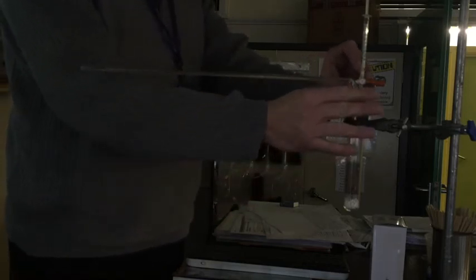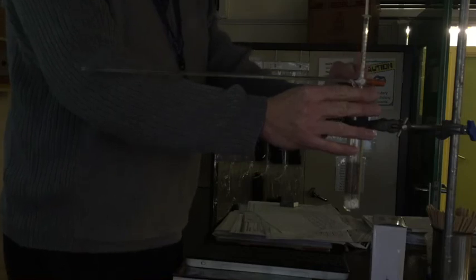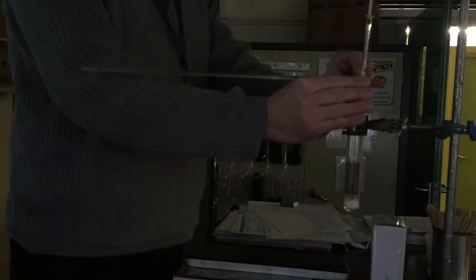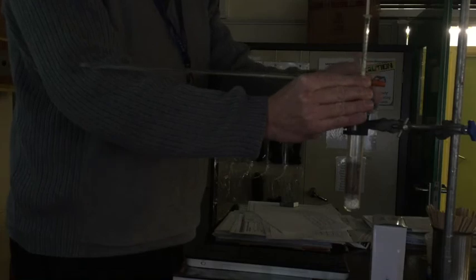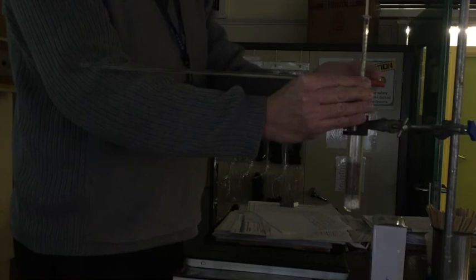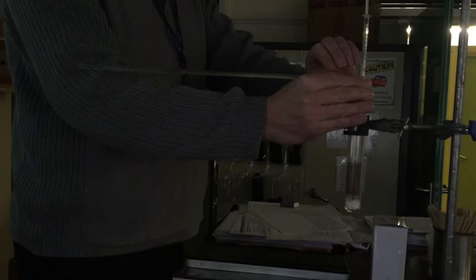So let's just demonstrate this very quickly then. I'm going to open this, and what you've got to do is you've got to turn it. You've got three little small prongs here, and we want to turn it so that basically like that, so that this large long handle is pointed towards the valve. So 180 degrees, and then when you want to open it again you turn it 180 degrees back again. Now it's going to start moving.